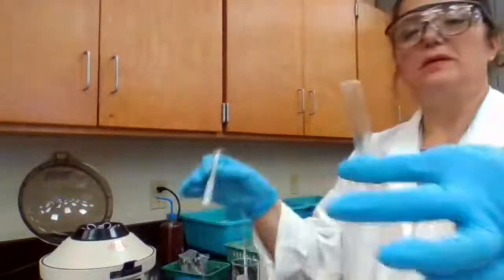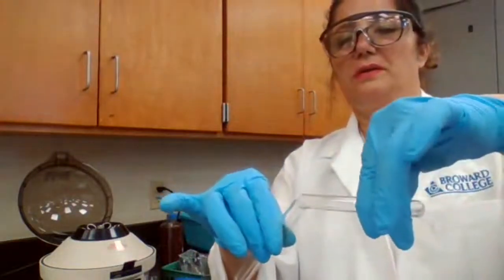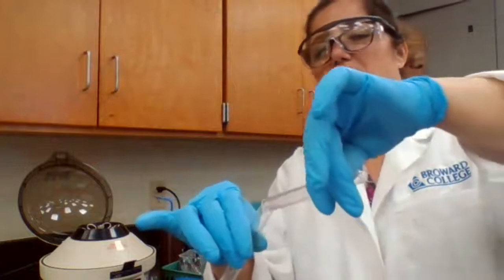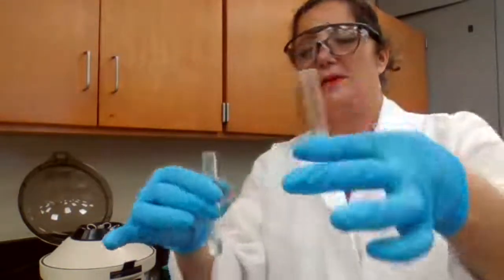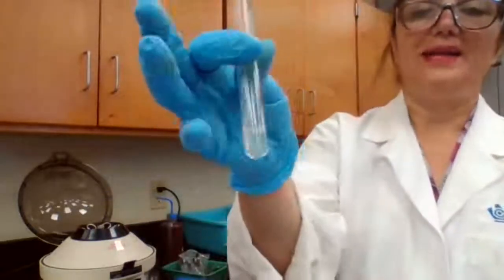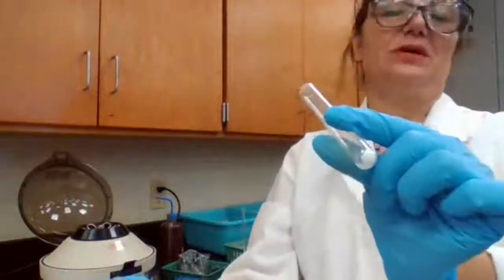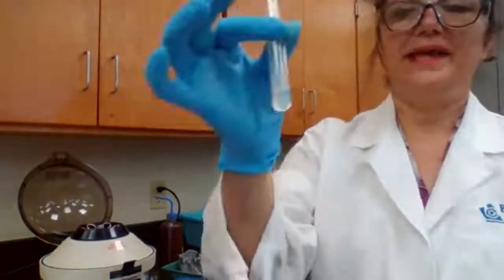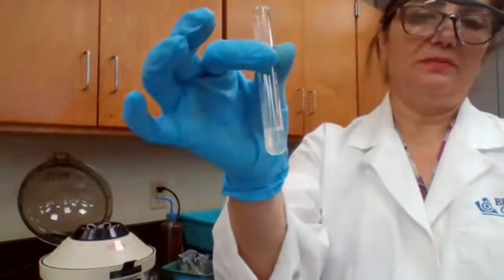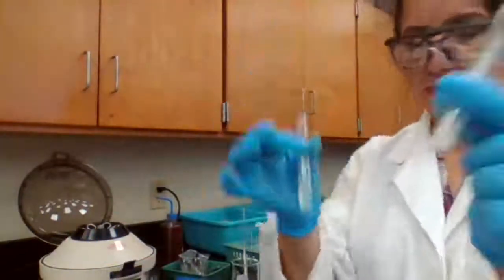Separate the liquid from solid. Because it's a known solution, I can confidently say that lead should be in the liquid form and silver is in the solid form. If it was unknown, all I can say is there could be lead in the liquid form and solid for silver. So lead in the liquid and solid.